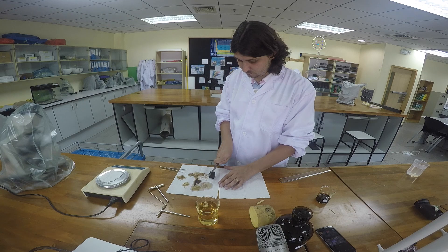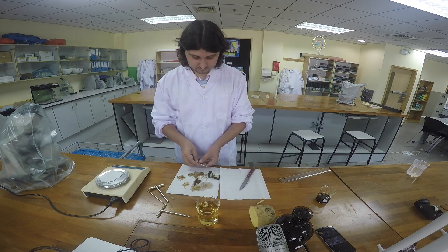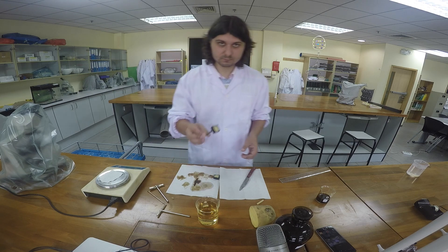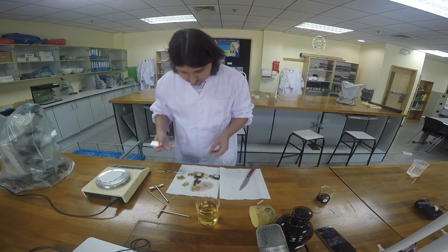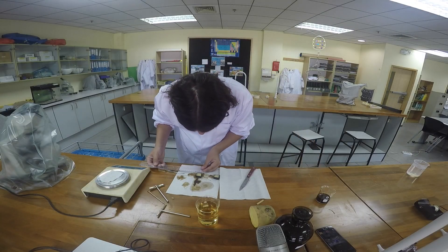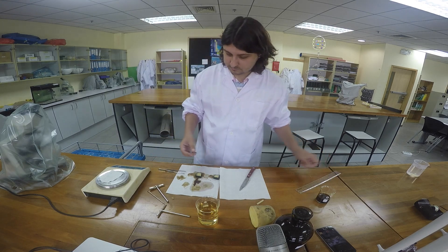To collect your dependent variable, cut the potato cube in half and measure the total area of the exposed interior of the cube. Then measure the area of the yellow square at the center, which does not come in contact with the iodine, and subtract this value from the total. With these values, you can obtain the percentage area diffused with iodine — your dependent variable.